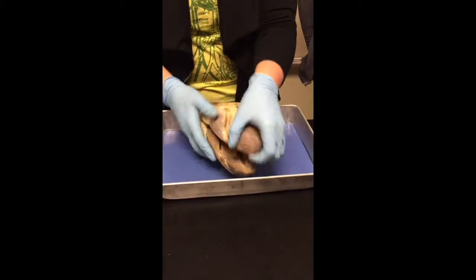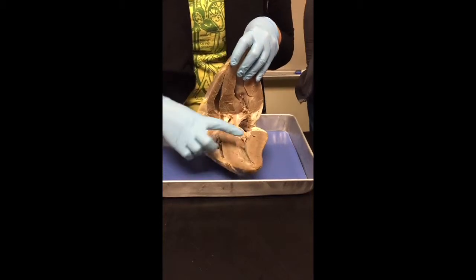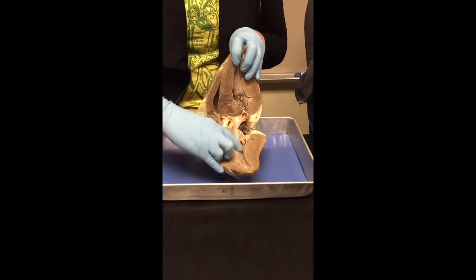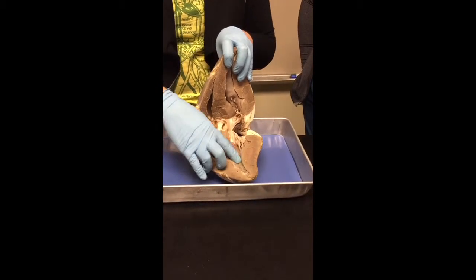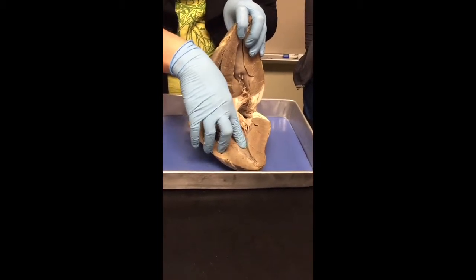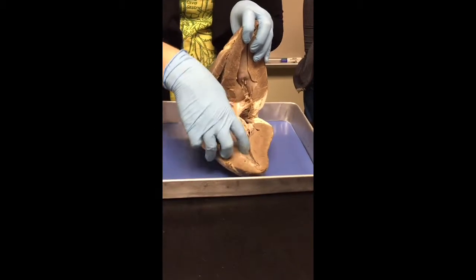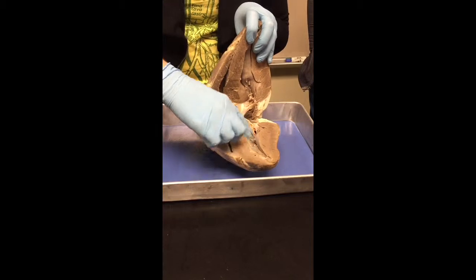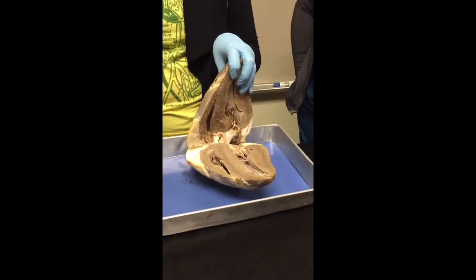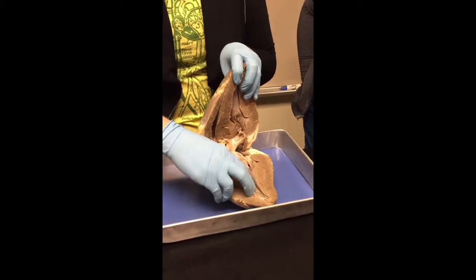All right, when you open the heart, okay, what you'll notice is these cavities, these spaces. Those are either going to be atria or ventricles. I'll tell you how to identify them. Lining those, do you see the tissue? It's really smooth. That really smooth tissue that lines the cavities is called endocardium. Endo because it's the most inside, and it's really, really smooth because this is where blood is going to touch. Blood is going to flow through these cavities. We don't want blood to have a lot of friction against it. We want it to flow very nicely and quickly, so we want that tissue to be really smooth, right?